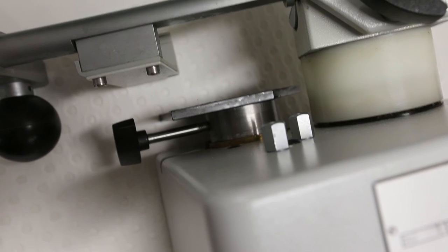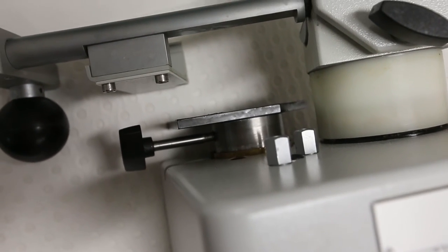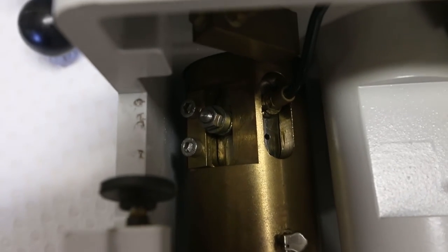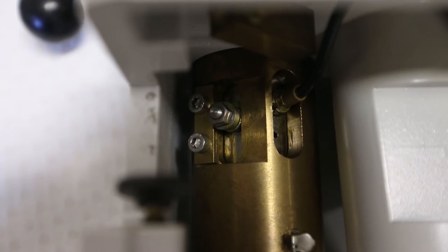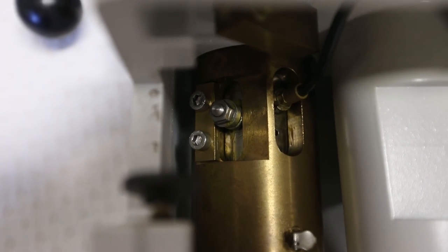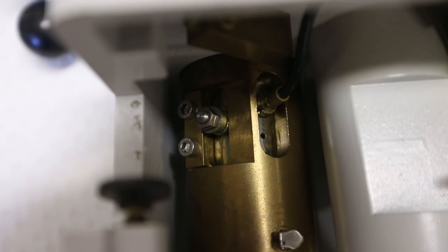So there's no way of adjusting it, and there's no way of cutting sections on it. As near as I can tell, it's probably something inside this brass cylinder. I don't know what's going on inside there, and Leica no longer has a service engineer that works in Australia. So there's no one to look after freezing microtomes anymore in this country, and so there's no one to even ask what's going wrong. As near as I can tell, it's something inside this brass cylinder.